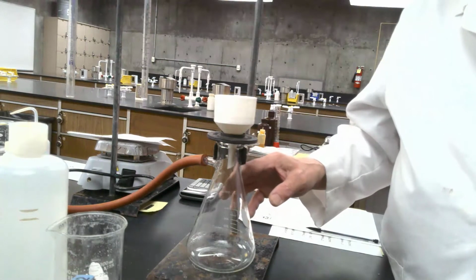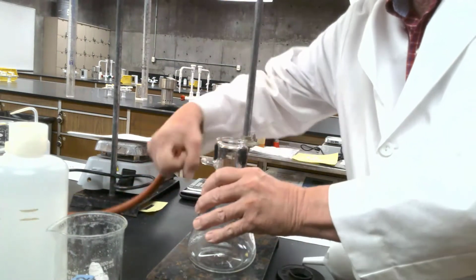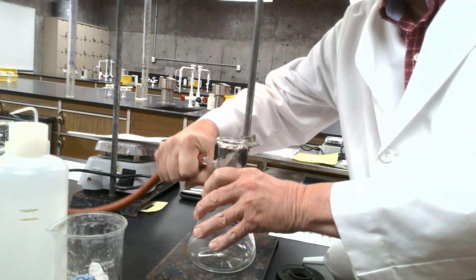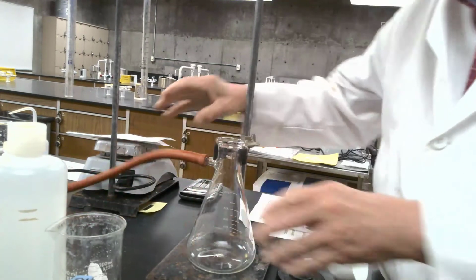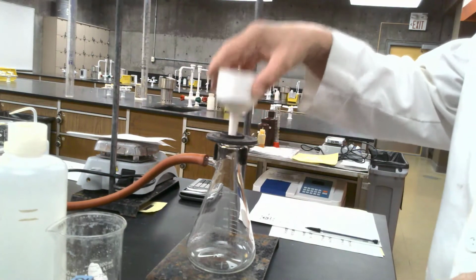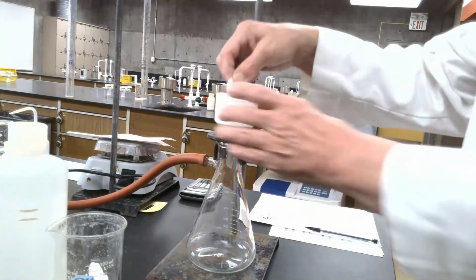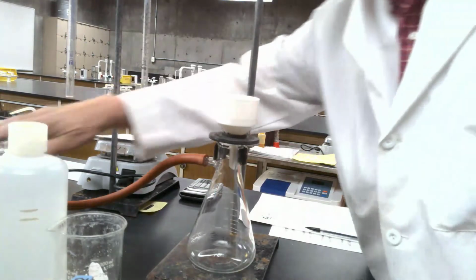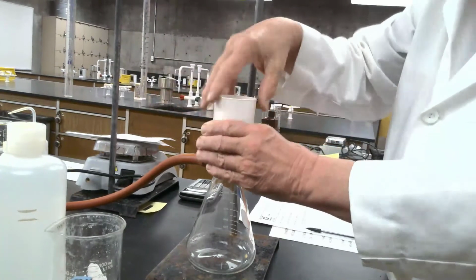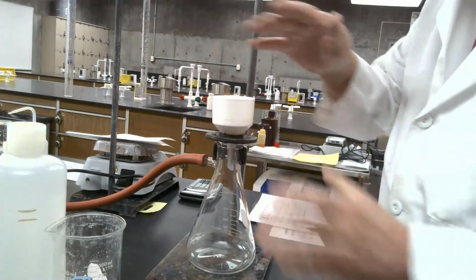We have to wash our crystals. We're going to use a sidearm flask. If you notice, this is a sidearm flask. It's got a little arm on the side here. We'll hook it to a vacuum line. And then I will put a filter back on top, a Buchner funnel. This is a Buchner funnel, if you're not familiar with it. And then I'll put filter paper that's pre-cut that fits exactly in there. And when I turn my vacuum line on, to get a good seal, you can see that I got a good seal.